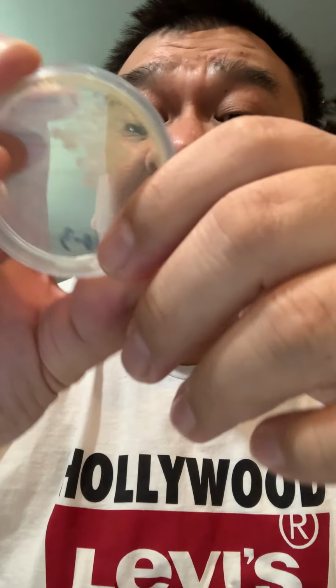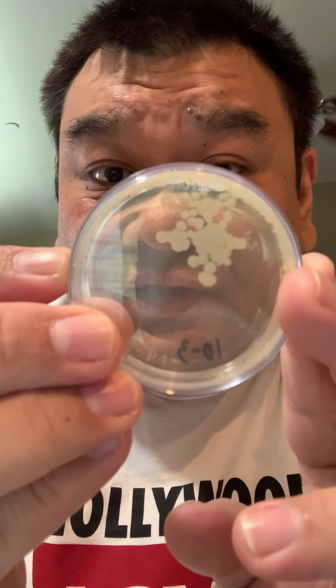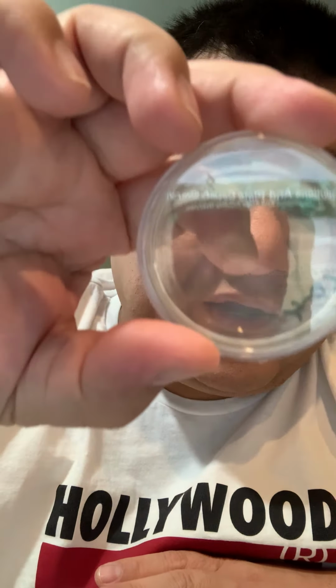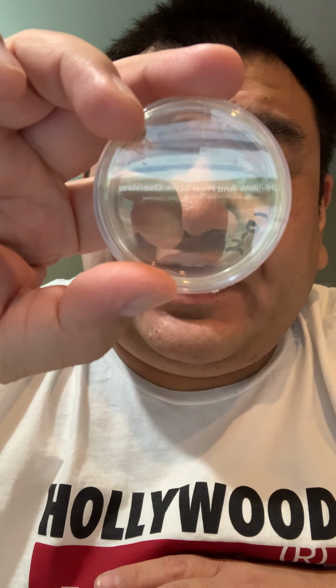And then my 10-3, with this, I only saw what you see on the video. I had dots that are visible and easy to count. But 10-4, 10-5, and 10-6 weren't visible at all. As you can see, this is 10-4, and I could see through it. I'm not so sure if there's anything in there, or is it the agar, the reflection of the agar that's showing.